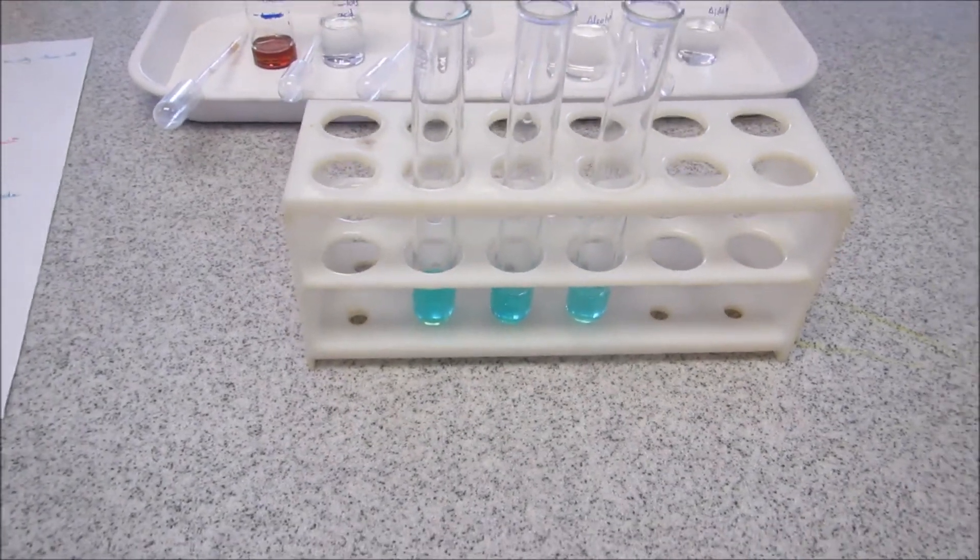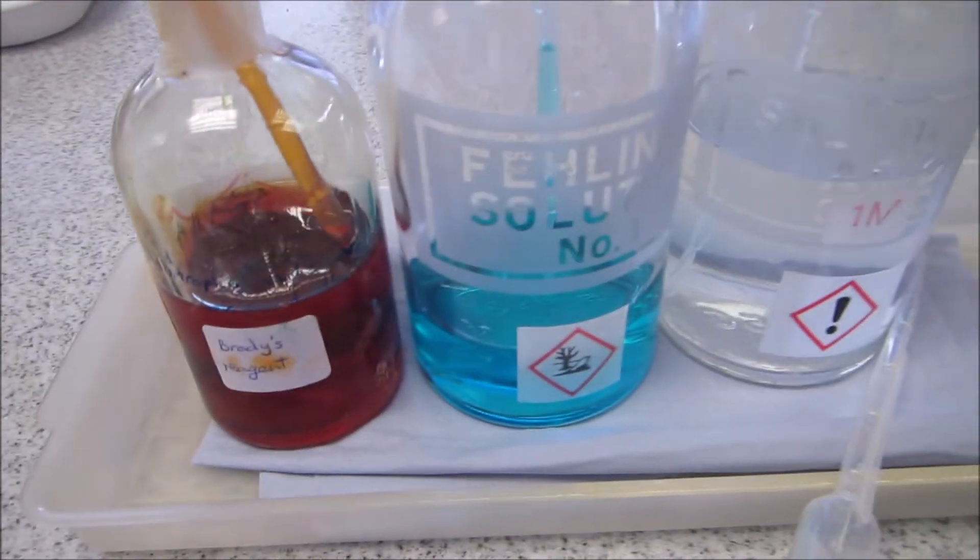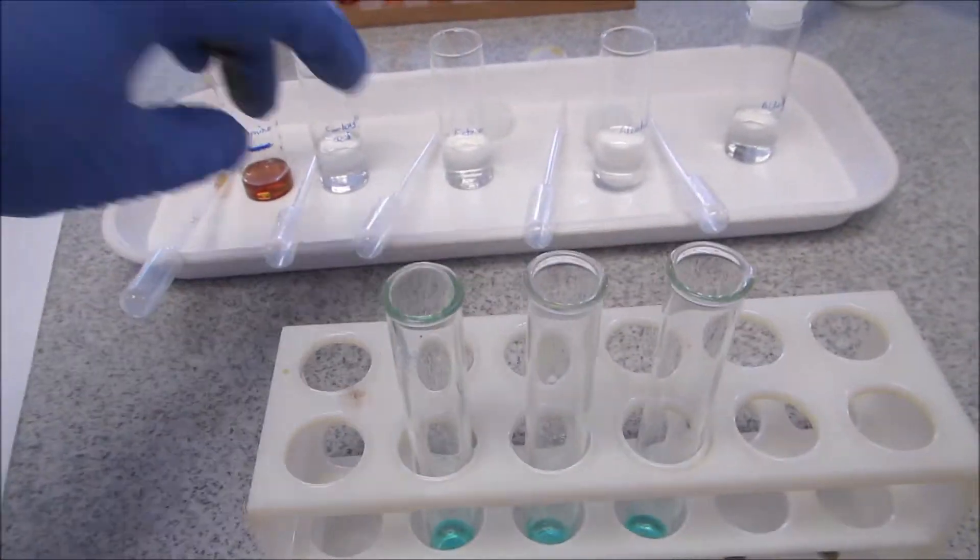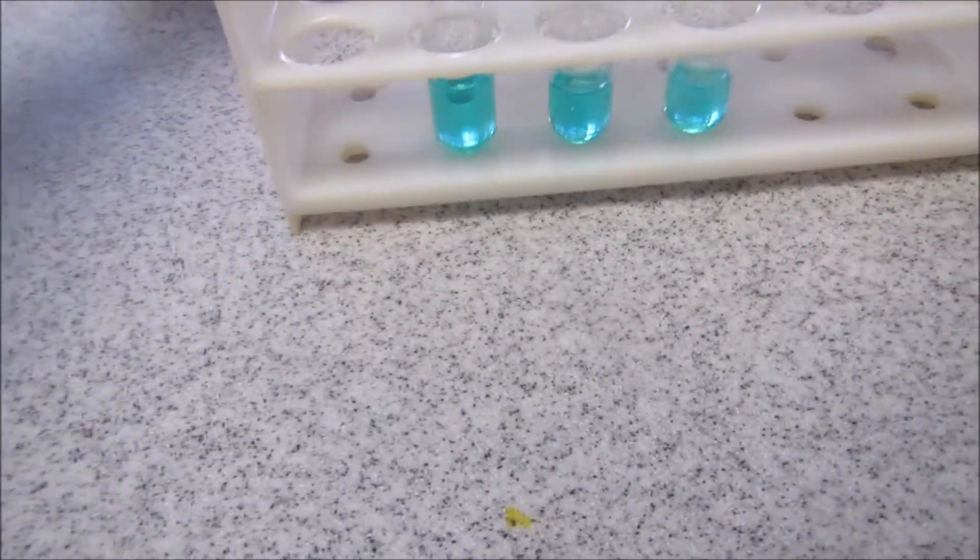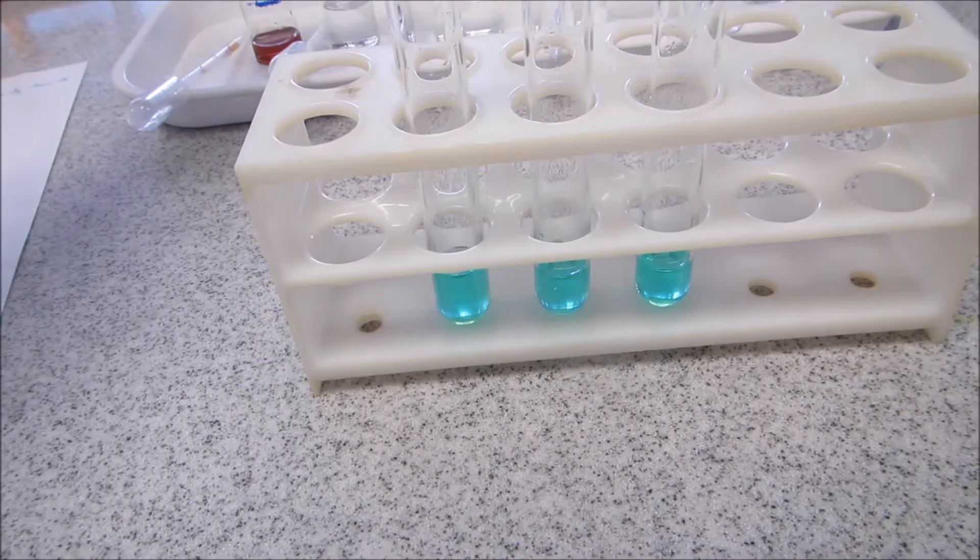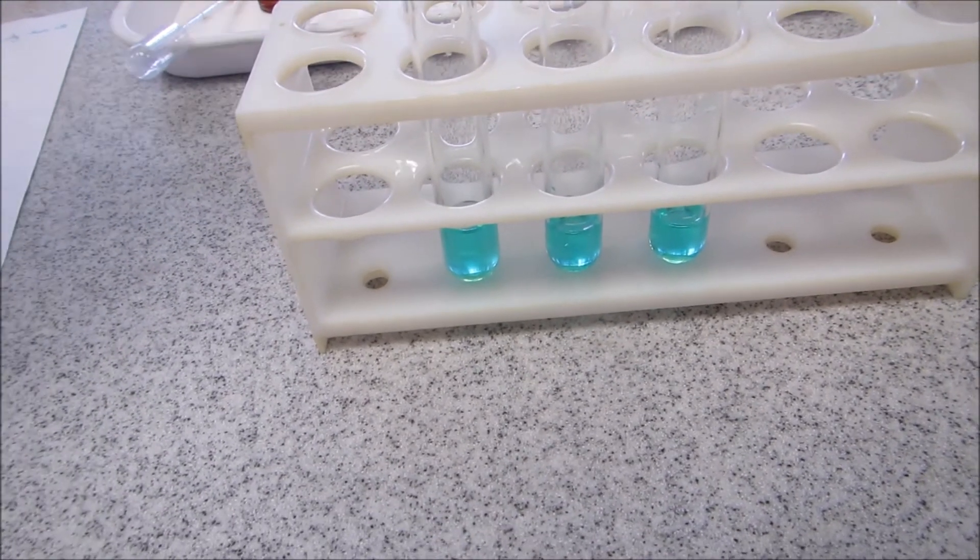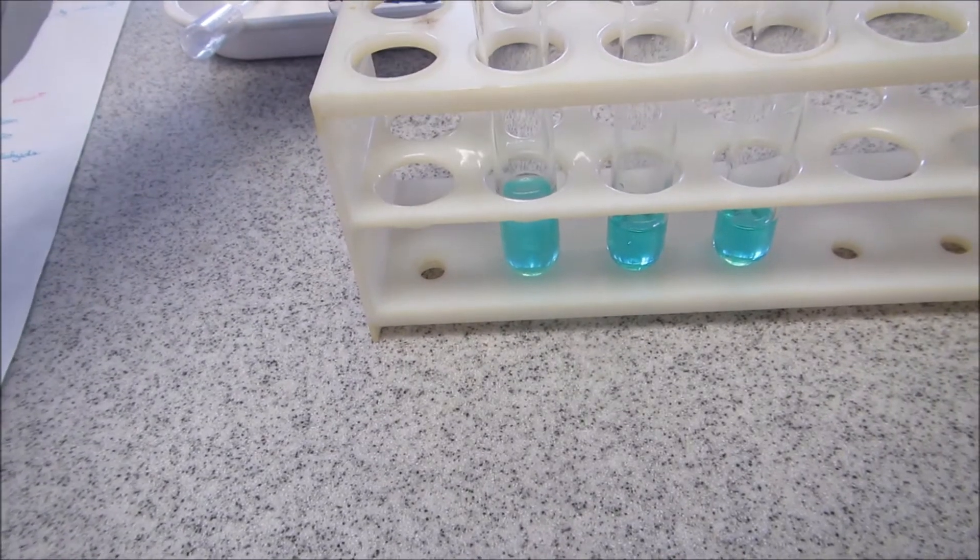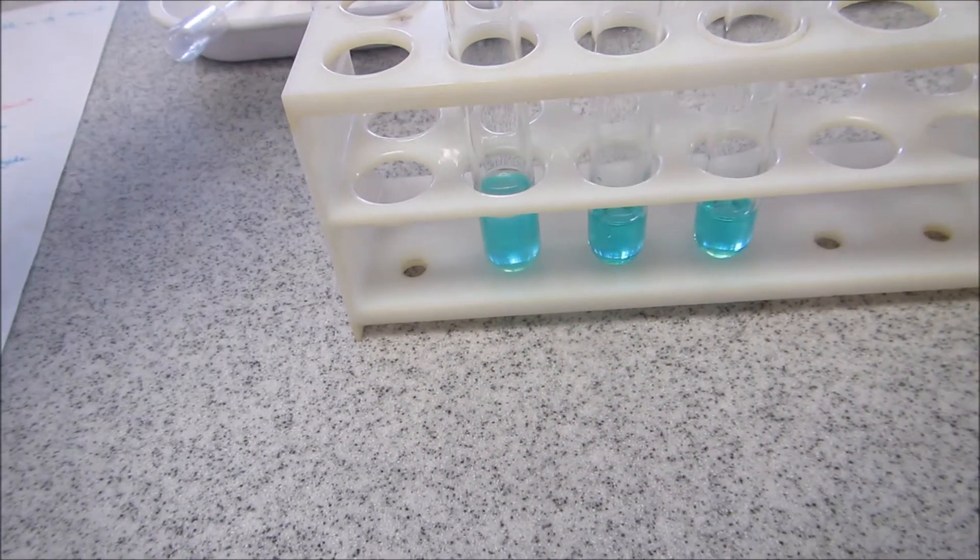So again, into three test tubes, I've measured out some Fehling's solution. I'm going to start again with the ketone. I'll add some ketone. What do you observe? Is there any reaction?